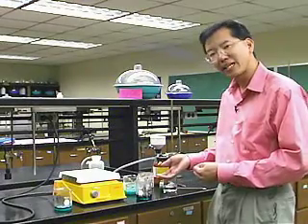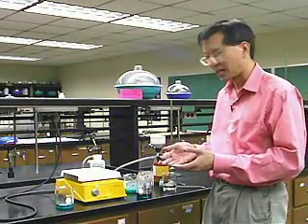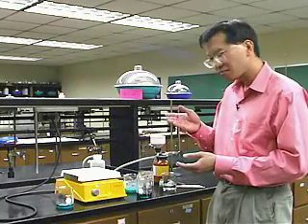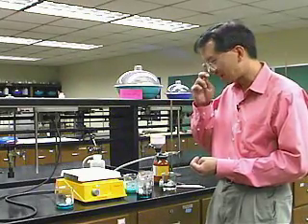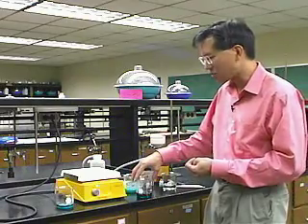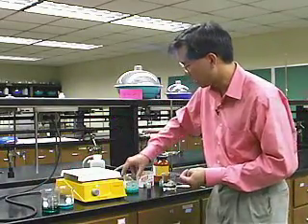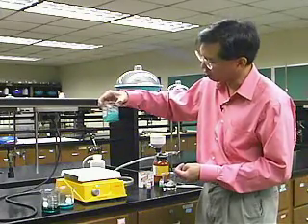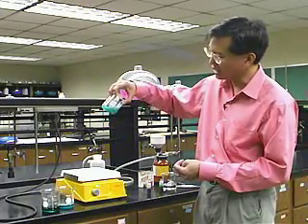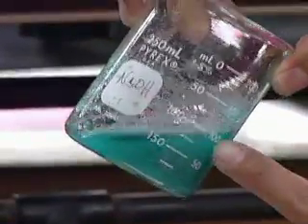It's saturated at the high temperature, but as we cool it down, it becomes supersaturated. Its solubility increases as you heat it up, so as you cool it back down, its solubility goes back down. And when the solubility goes back down, what happens? The material crystallizes, and that's what's gone on here. This is a beaker that I prepared before, and it's sort of a sludgy mess now that has the food coloring in the water and the crystalline acetylsalicylic acid.